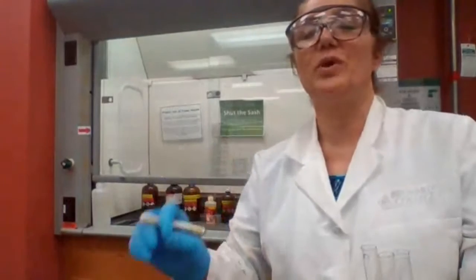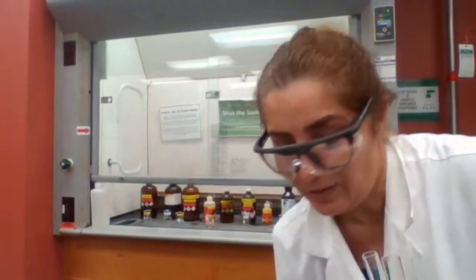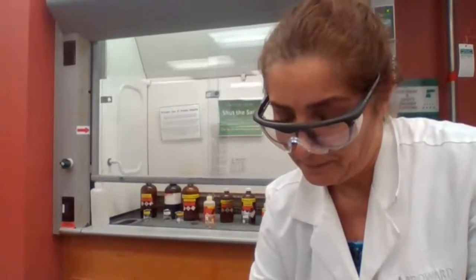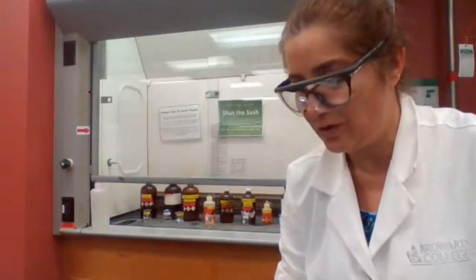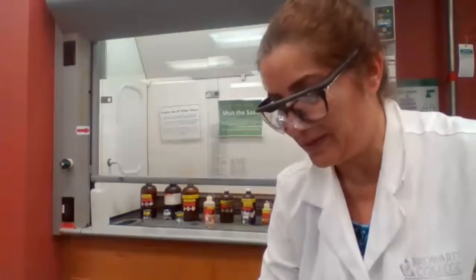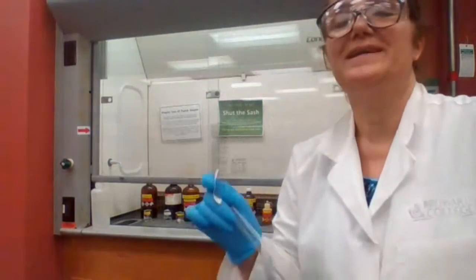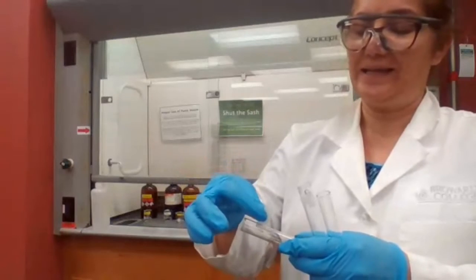I'm going to label while you're writing your responses. When I go back, please give me evidence and tell me what it means. Because if you just give me evidence, I don't have kindergarten anymore, but I used to, when I was teaching. My daughter at age 4 could tell me what color change. I can't use that as an example anymore, but what I want is what the indication is.